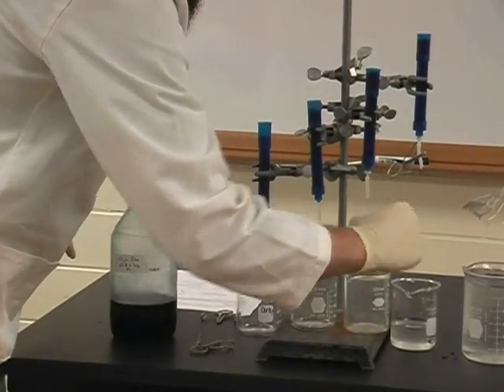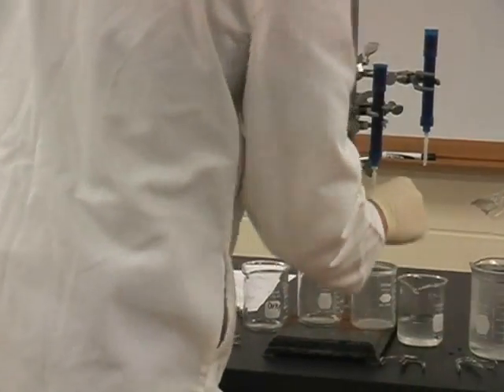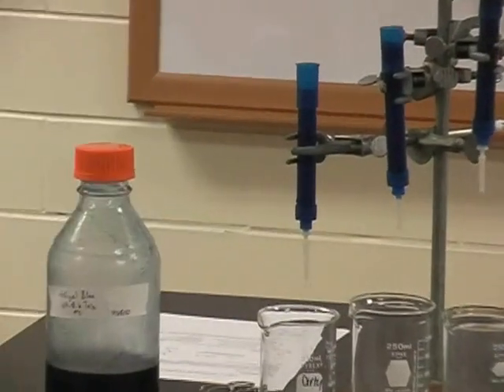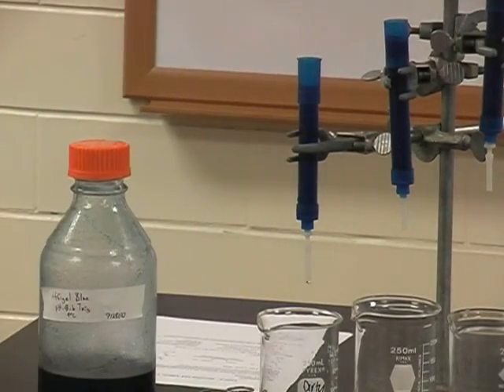Here a mixture of the beads and buffer are combined into a column and the liquid is allowed to drip out, creating a solid column from the agarose beads.